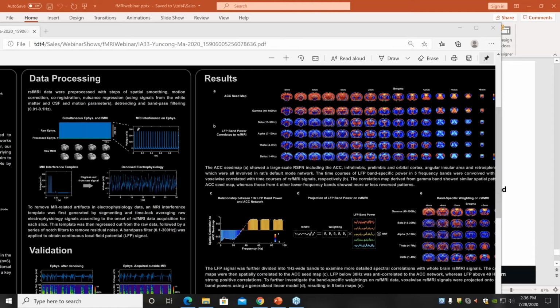And because the TDT offers high resolution signal recording, we could further divide the LFP signal into 1 Hz band powers, as shown in Figure C. So we could use those dedicated band definitions to understand how this neural activity correlates to fMRI signal. And the result shows that the gamma band power from 40 to 100 Hz, which we can take all the way to 300 Hz in LFP, is positively correlated to the BOLD signal. And the lower bands under 30 Hz show negative correlation.